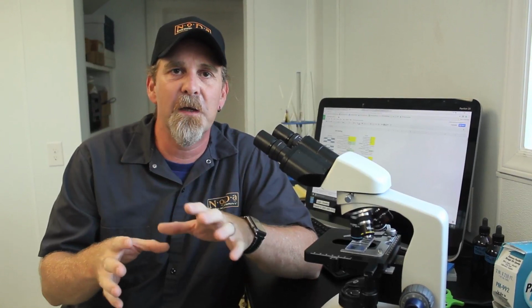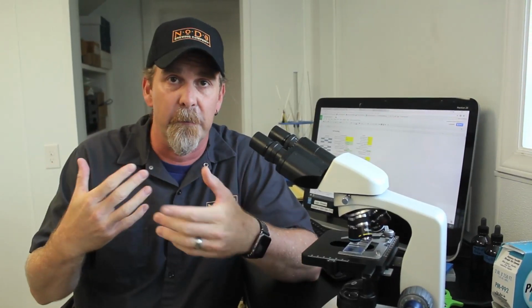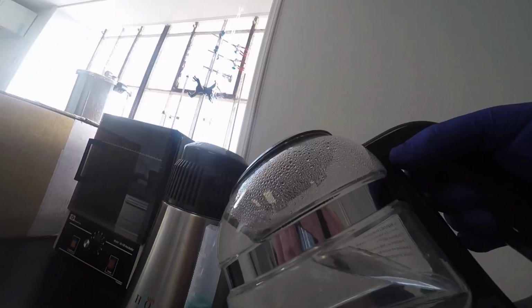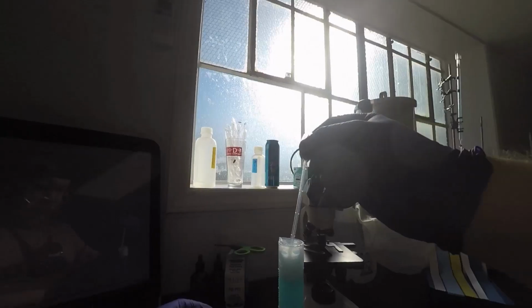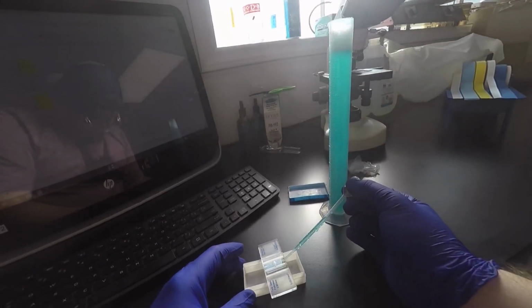So probably our biggest responsibility here in the lab is making sure that we're putting enough yeast in the wort to make sure that it ferments out properly. Whether that's coming from the yeast propagator, which we'll talk about in a second, or another batch of beer, or possibly a starter or something like that, we want to make sure that there are enough yeast cells in there to do the job. So what we'll do is we'll take a sample of that yeast, bring it in here, put it underneath the microscope, take a look and count the cells, and make sure that they're happy, healthy, and that there's enough of them to ferment the beer out properly.